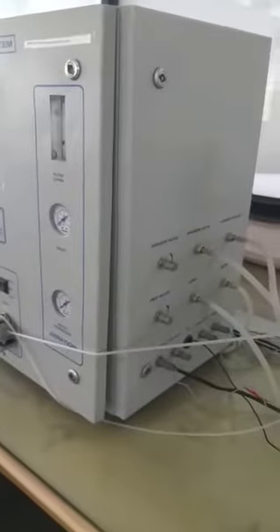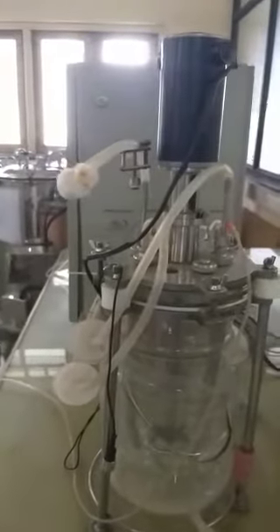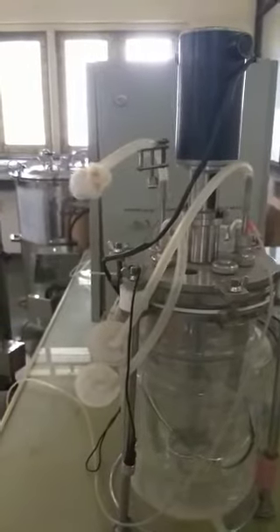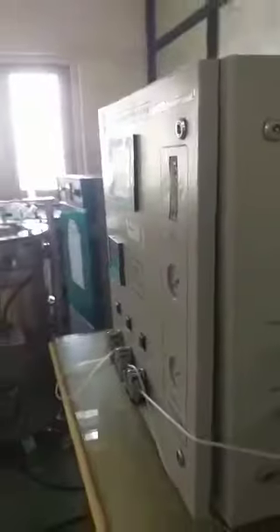Now let us see the procedure of the fermentation process. First, connect all the parts and probes of the fermenter. After that, fill the bottles with acid, alkali, and anti-foaming agent. We fill these because during the process they help to control all the parameters.